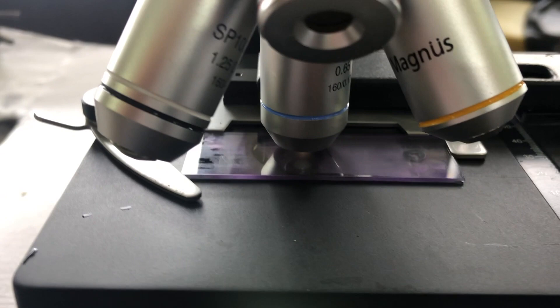After washing, you air dry your slide and then put it under a compound microscope.